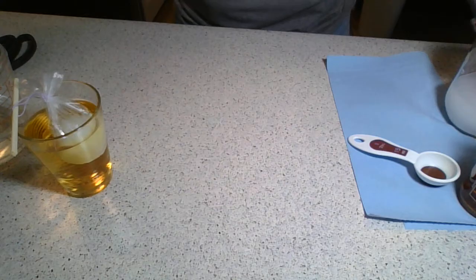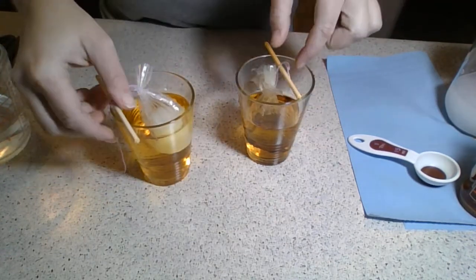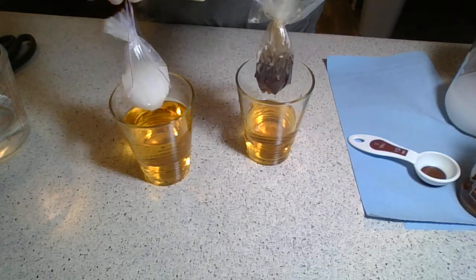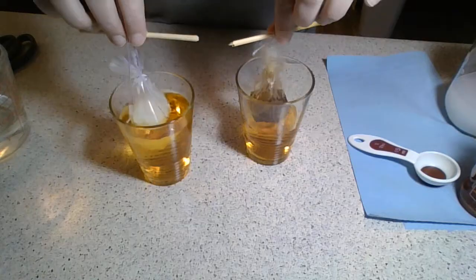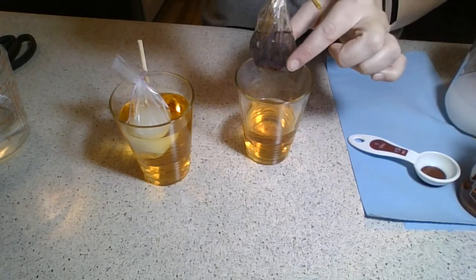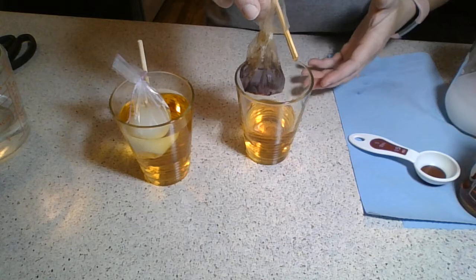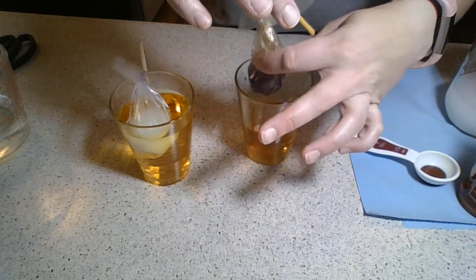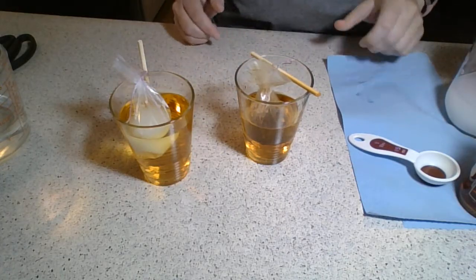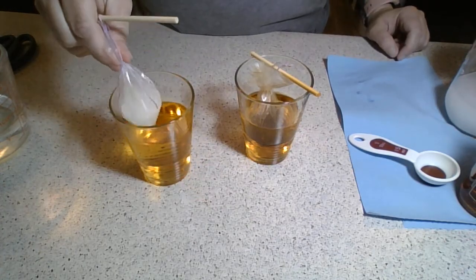So I'm going to pull up my first sample, which has been sitting for a couple hours now. We can see there is quite a difference. Our cell that's been sitting in the iodine for a while is now purple, and here is the one we just put in — this is how it started, and this is what it looks like now. So there is a reaction. Iodine reacts with starch, and in this case our reaction occurred inside of the bag. Our iodine in the glass is still a clear amber color, and our baggie has turned purple. The starch in our bag is now purple, which is a positive indication for the presence of starch. If we were to let this one sit for 25 to 30 minutes or longer, we would see a similar reaction occur inside of this baggie also.